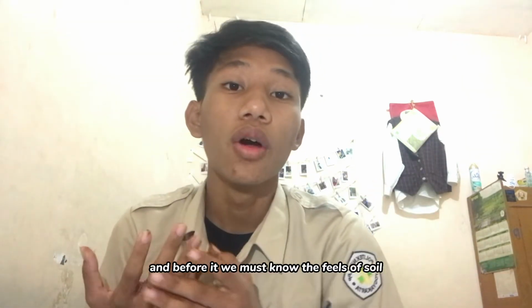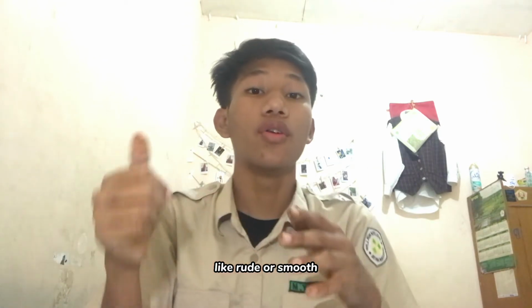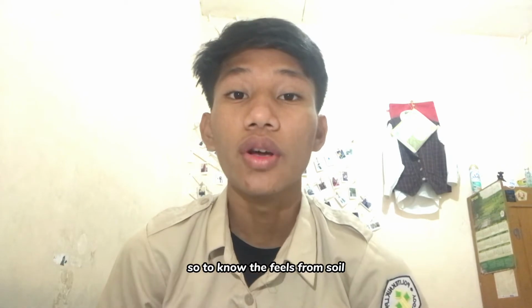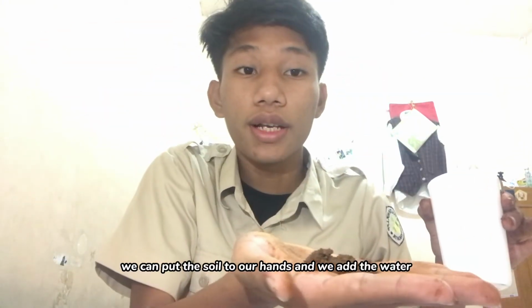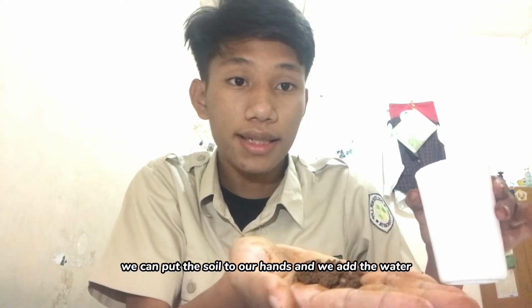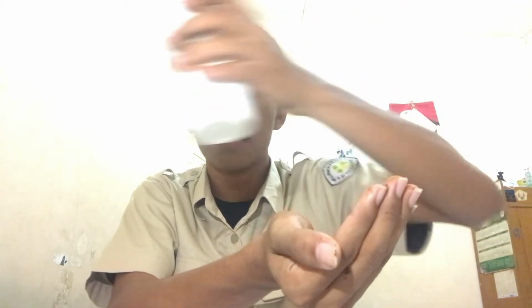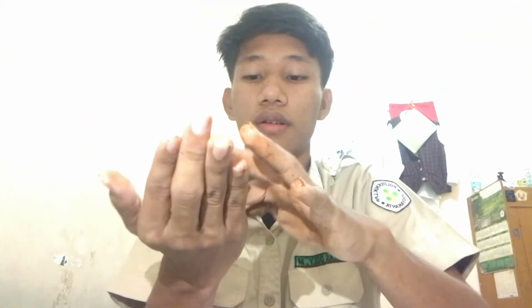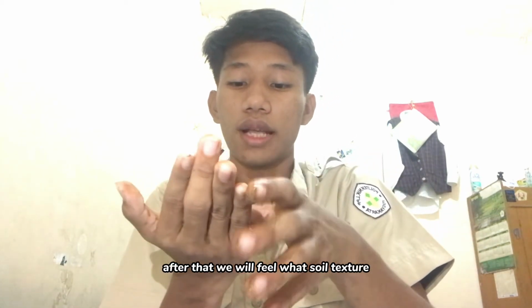And before that, we must know the feel of the soil, whether rough or smooth. To know the feel of the soil, we can do this. We put the soil in our hands and we add the water. After that, we will feel the soil texture.